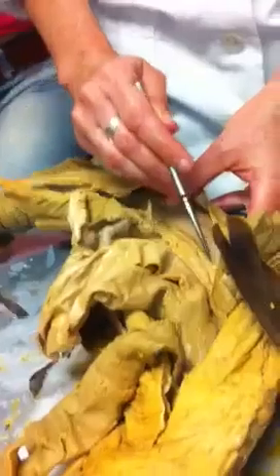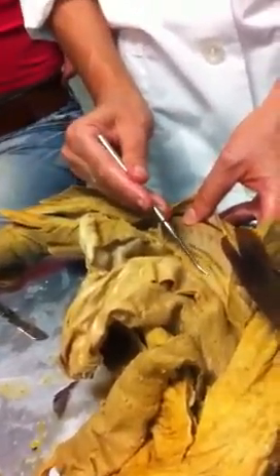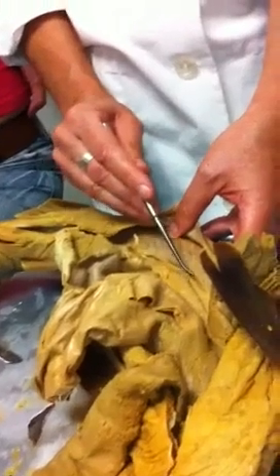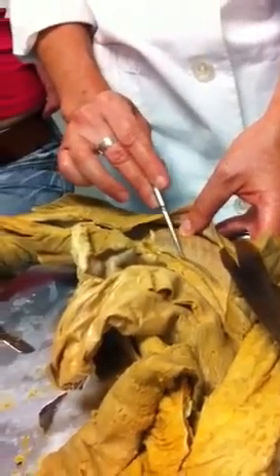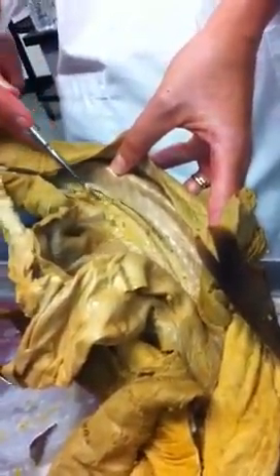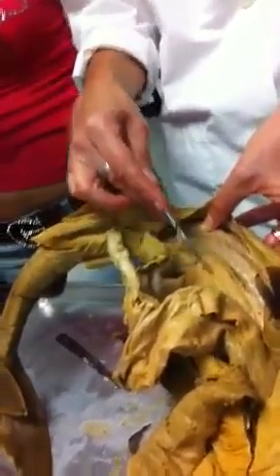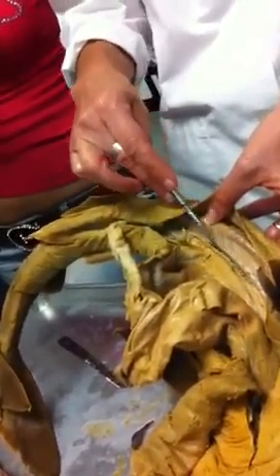The kidneys. We've got to find kidneys in the shark. And the kidneys, as you know, in every vertebrate are plastered to the dorsal surface of the abdominal cavity, usually totally enclosed by peritoneum. This one has been partly exposed in this shark. You guys see this kidney? It's running all the way along the dorsal surface, very long and skinny. If you totally dissect it, you will see that it's coiled up, lots of coiled up tubules. Right, there's one on the other side. So those are the kidneys in the shark.